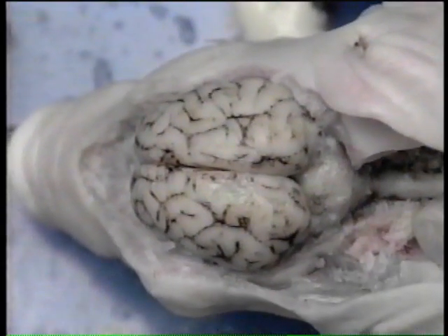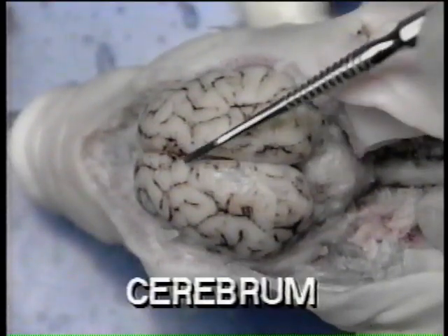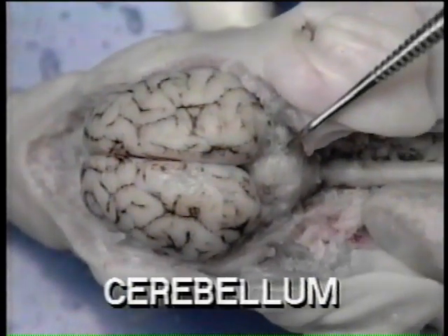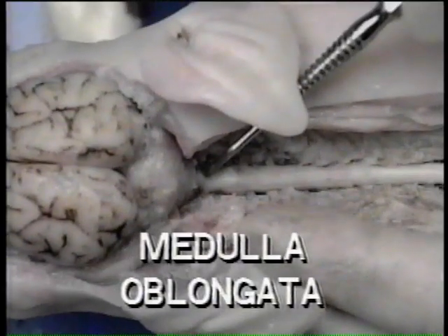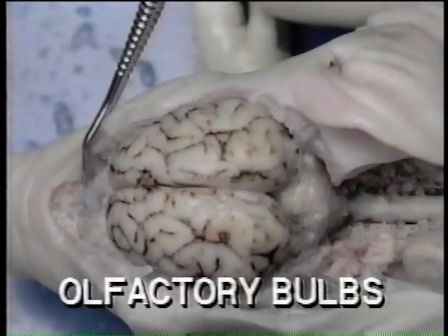Now, identify the gross features of the brain. The cerebrum is divided into the right and left hemispheres by a longitudinal groove. A smaller mass caudal to the cerebrum is the cerebellum. The medulla oblongata is continuous with the spinal cord. A pair of olfactory bulbs is located on the ventral side of the cerebrum.